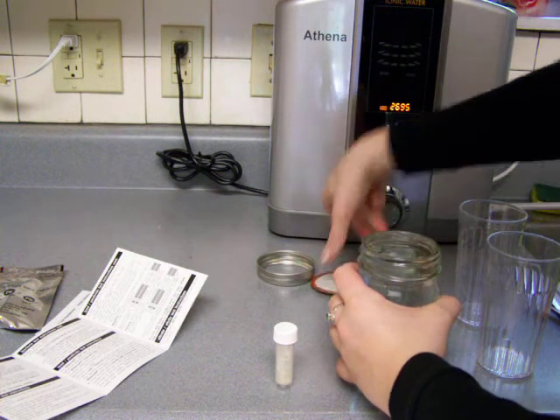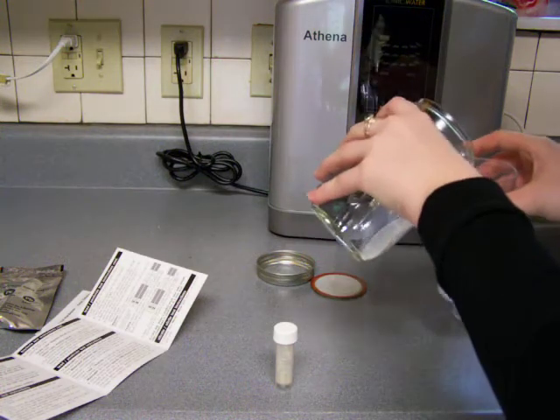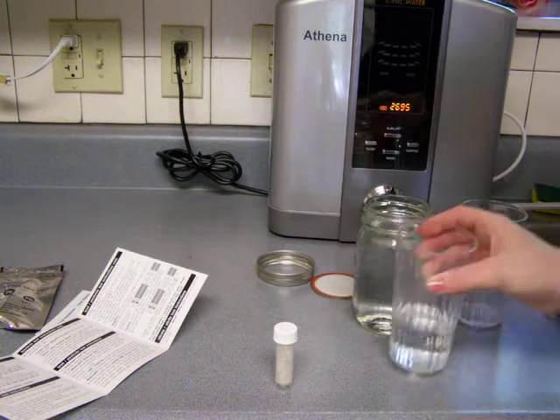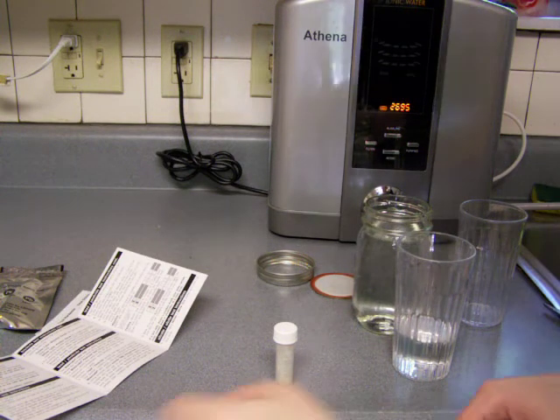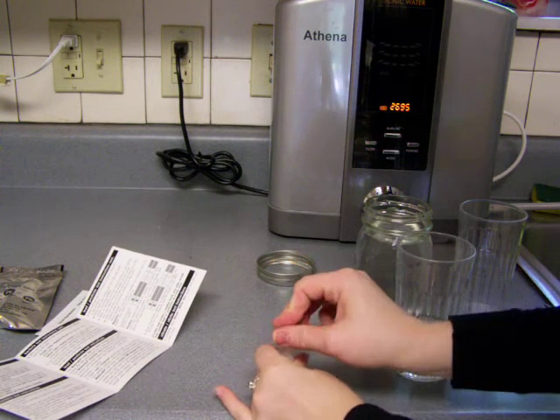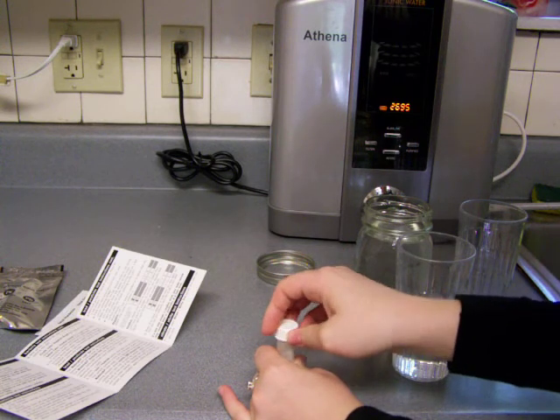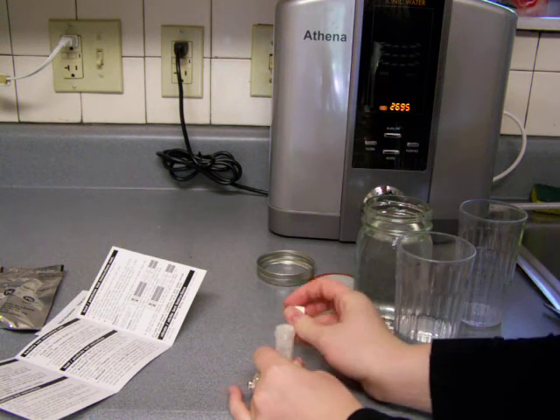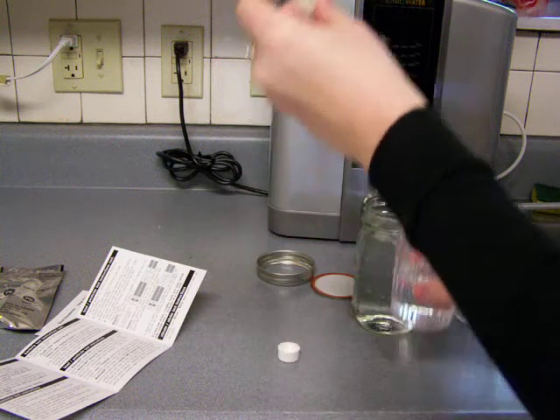Now, this water is actually pretty old. I got it last week, and then I meant to do the test earlier. Okay, so carefully twist off cap and fill vial to 1½ inch below the top. So the 5 milliliter line.